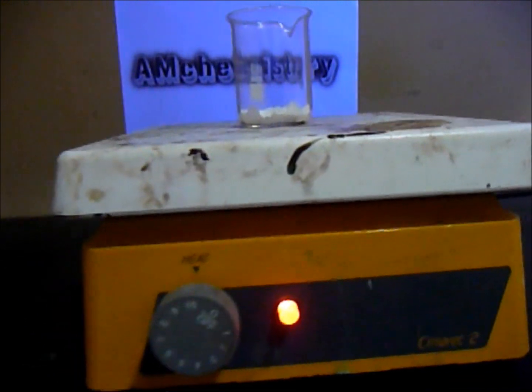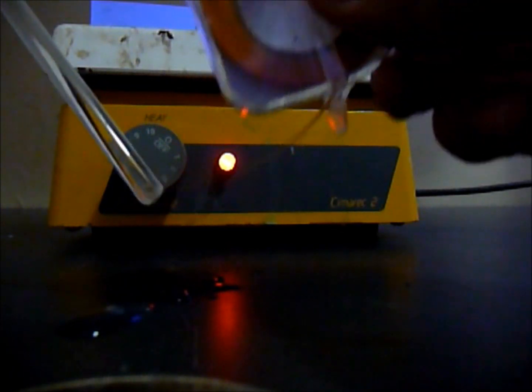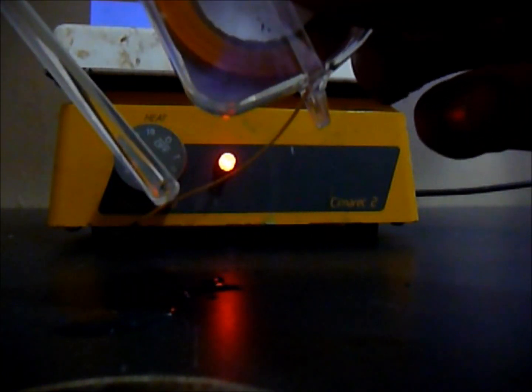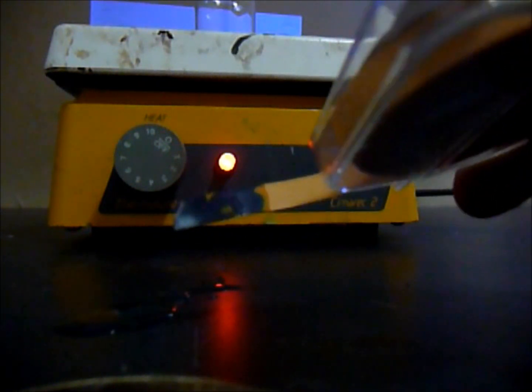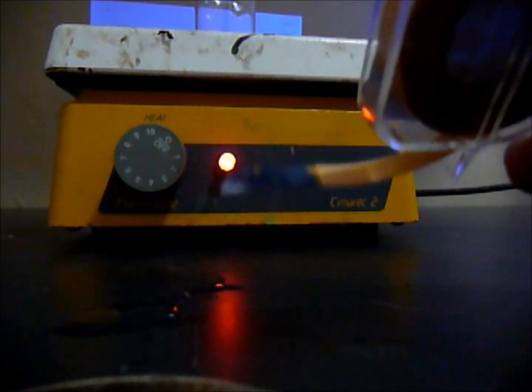And dip it to the, I think it's sodium carbonate. Just wet it again and get some pH paper, and touch it. As you can see, it turned purple, indicating it's sodium carbonate.